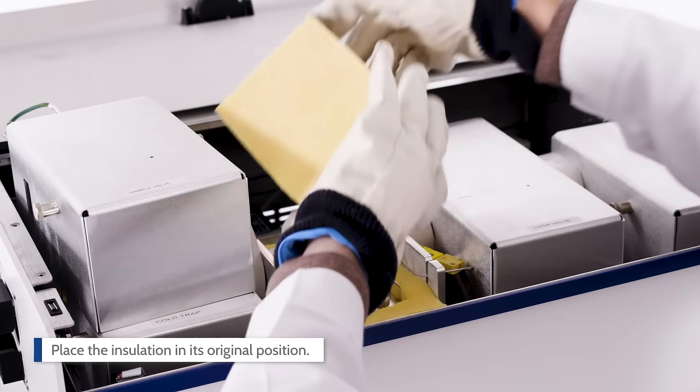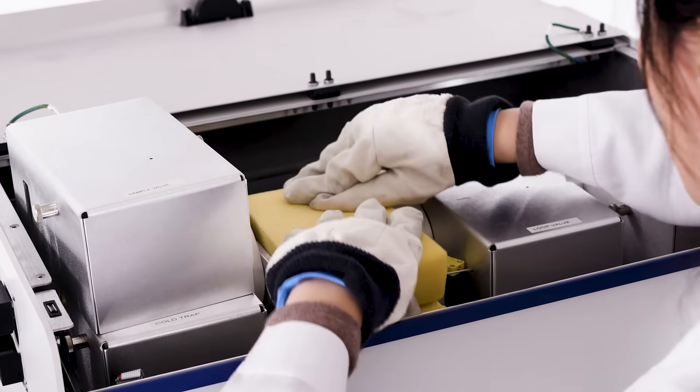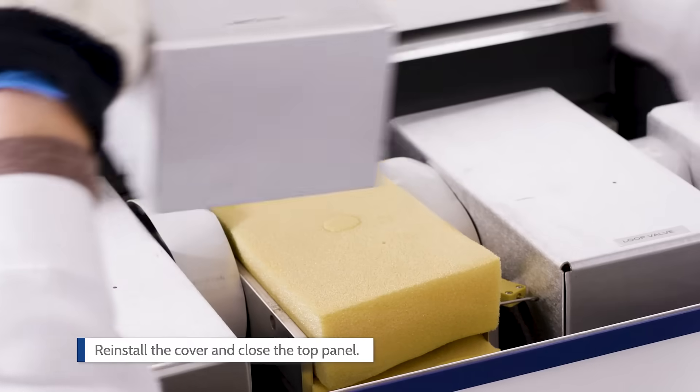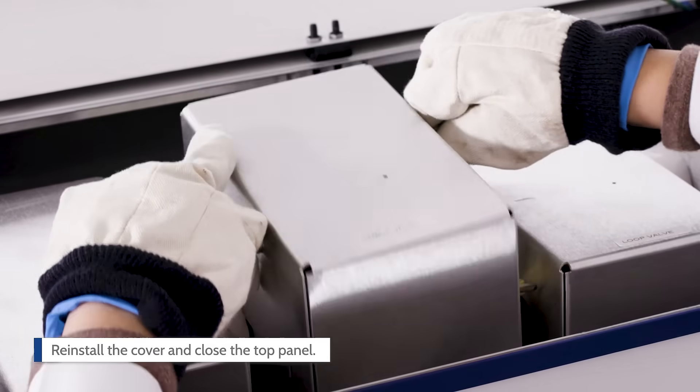Place the insulation in its original position. Reinstall the sample valve cover and close the top panel.